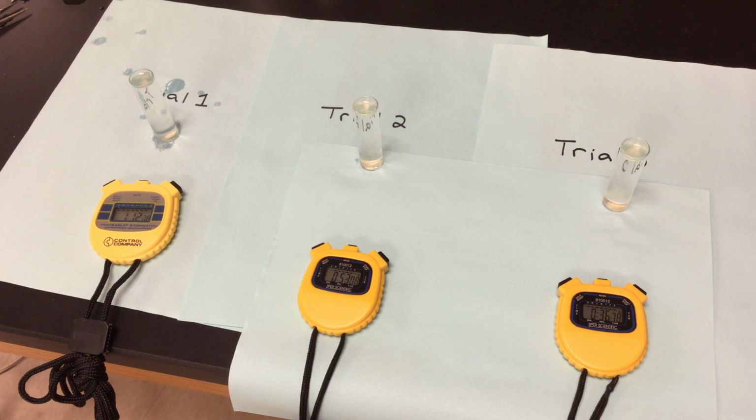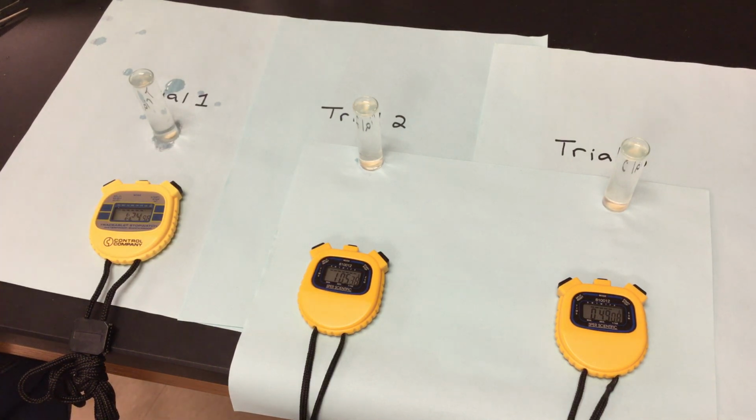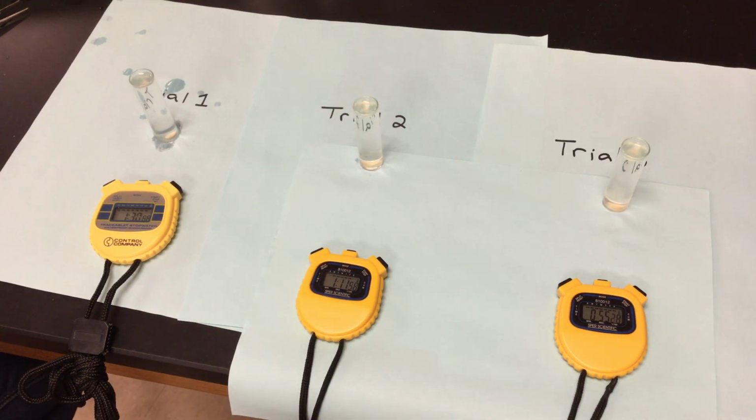So those pHs of 11, those discs are still at the bottom. Putting my yeast container back into some more warm water so that those yeasts can start to grow just a little bit. And we are at 1:23, 1 minute, 23 seconds, just about at a minute for trials 1, 2, and 3. We want to see how they work in pH of 11.